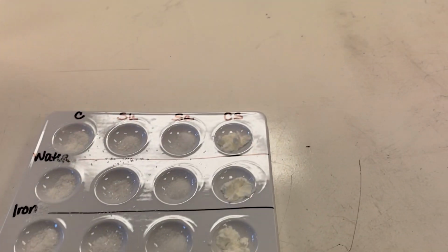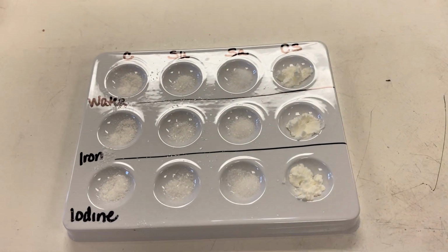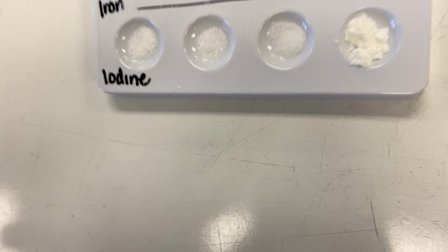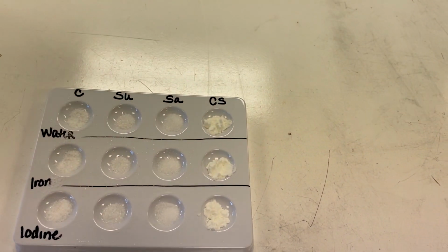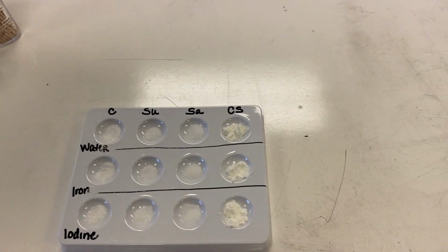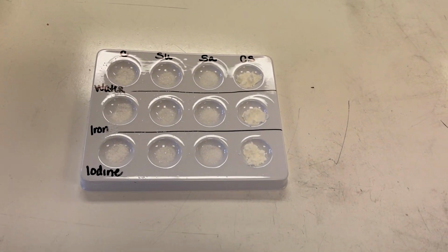I apologize, trying to get this in a good spot for you so you can see the reactions. And the camera just fell. No one should hire me as a video person, ever.